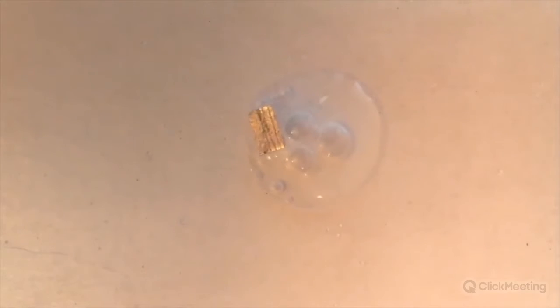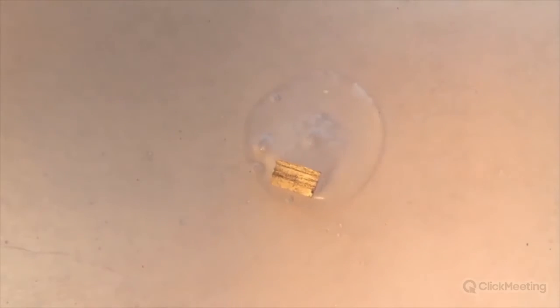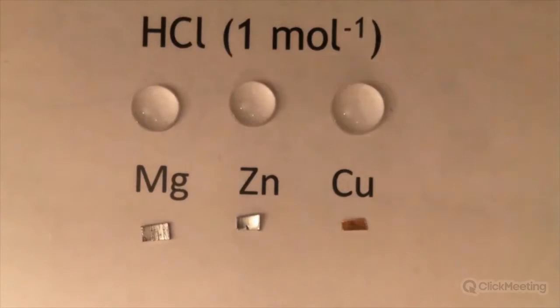And if you ask pupils what gas is produced, they will tend to say carbon dioxide, just because they associate carbon dioxide with fizzing and the bicarbonate soda and vinegar experiment. So you really need to get the pupils to think about what's reacting here. Magnesium with hydrochloric acid, that's the elements, and the gas being produced is hydrogen gas in the reaction. So this is another sign of reaction.